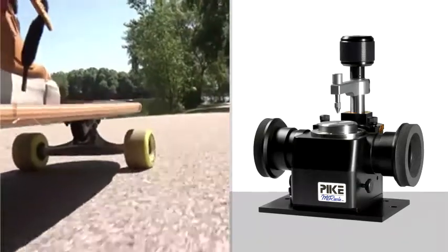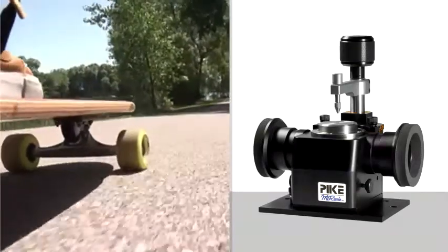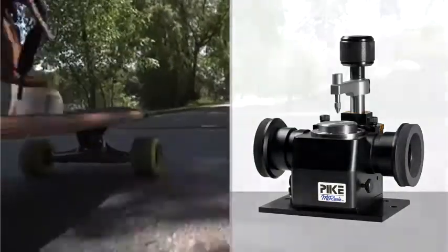To obtain an infrared spectrum, a background was collected on a clean crystal, followed by collecting the sample spectrum.